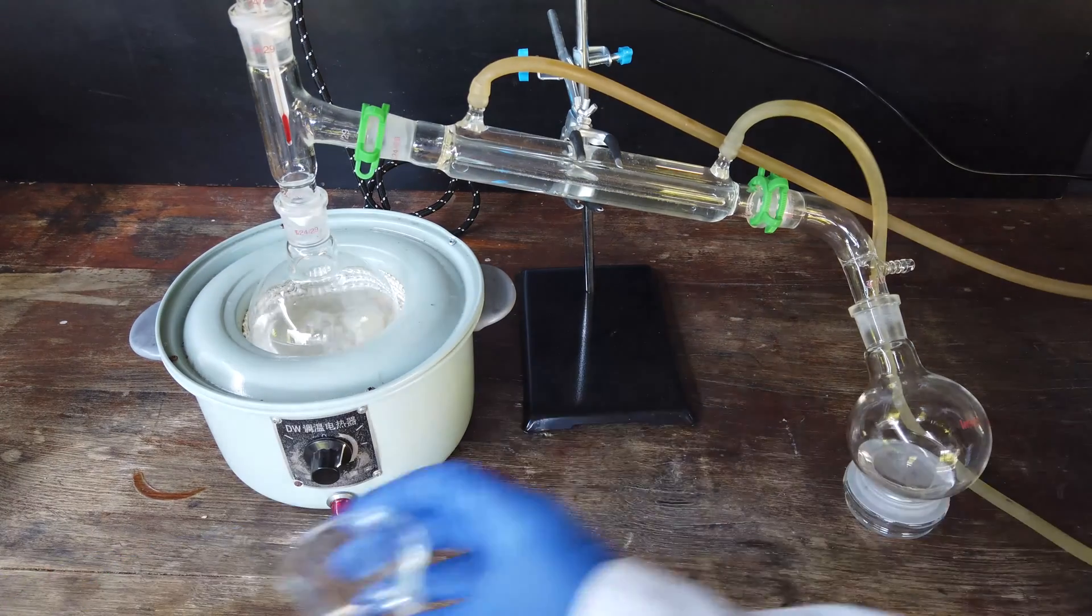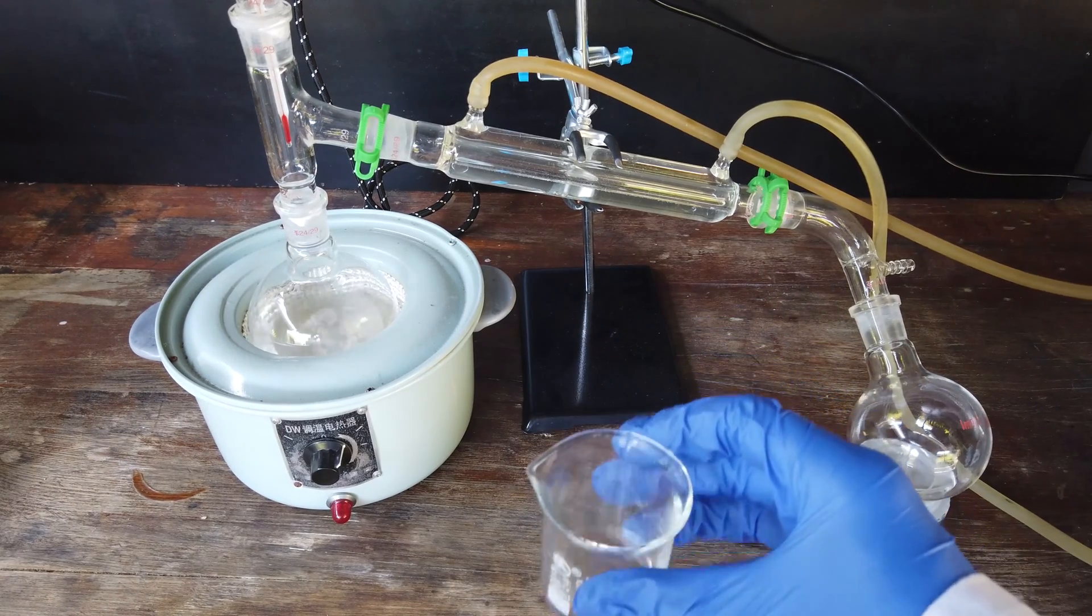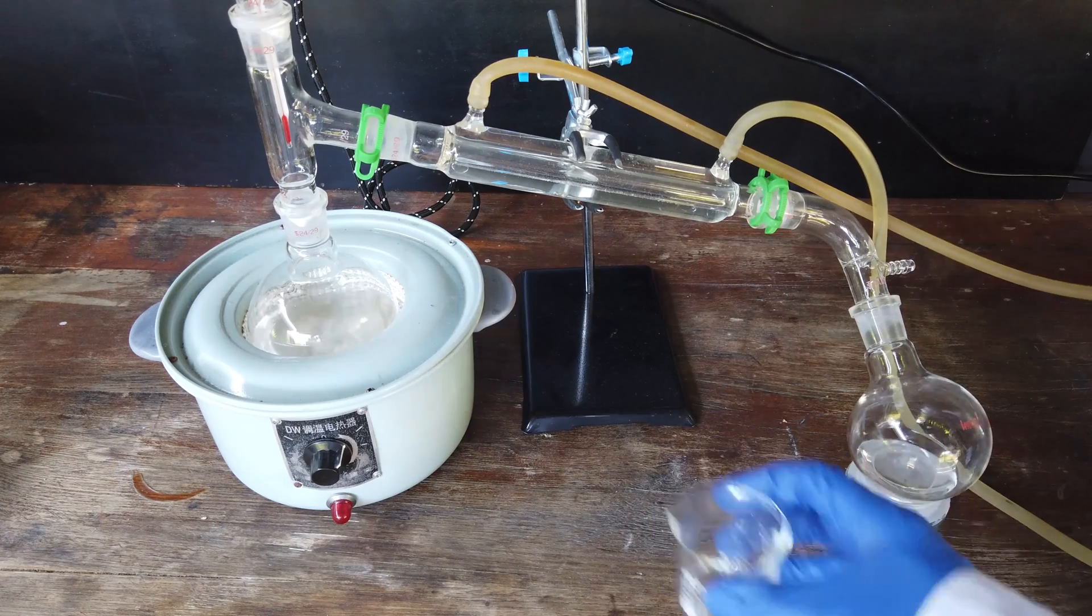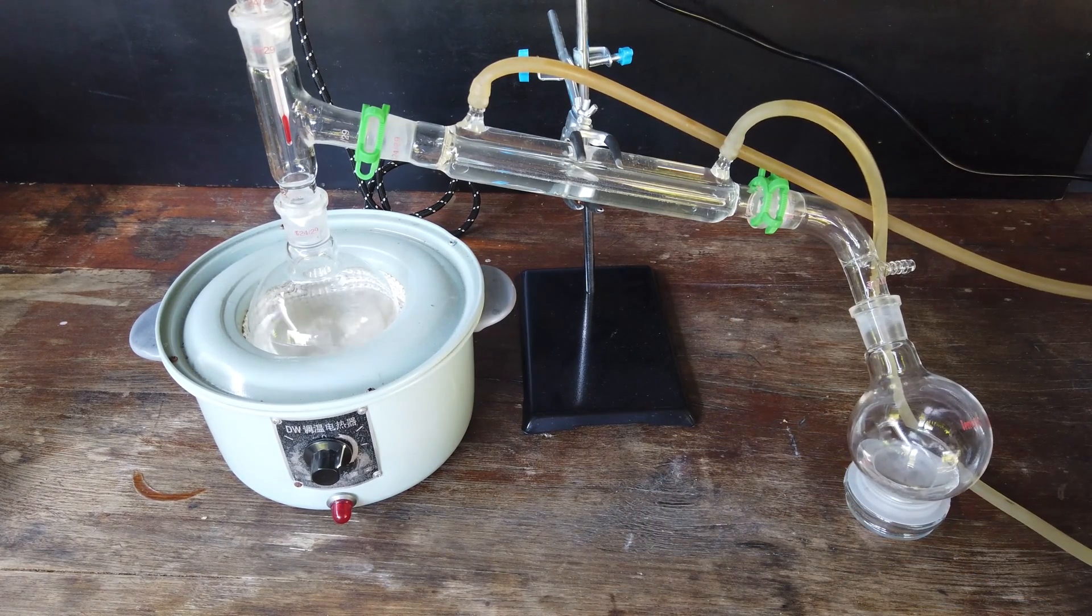Apparently very few volatile components. This stuff came across in about 10 seconds, and then the temperature shot up to around 75 degrees, which is about where we expect the azeotrope of methyl ethyl ketone and water to be.